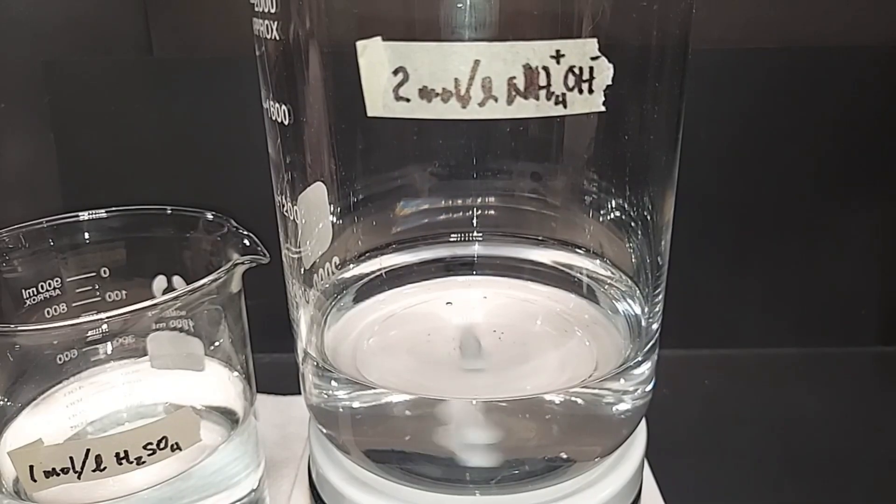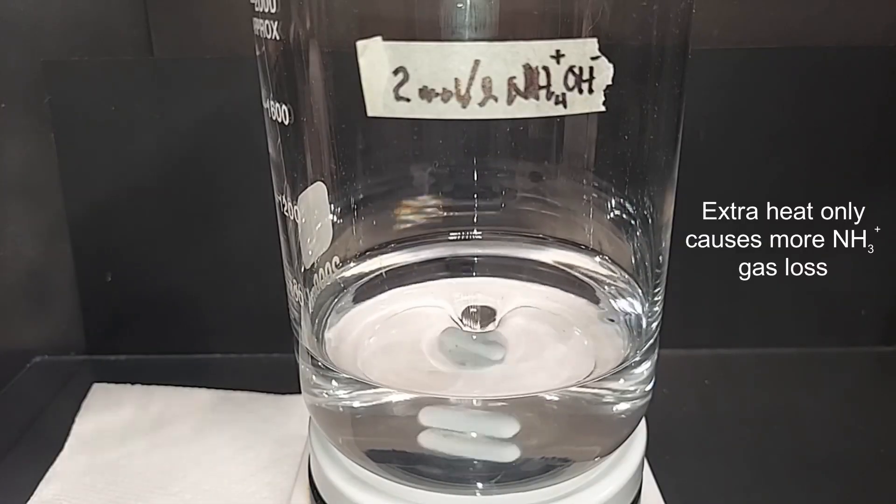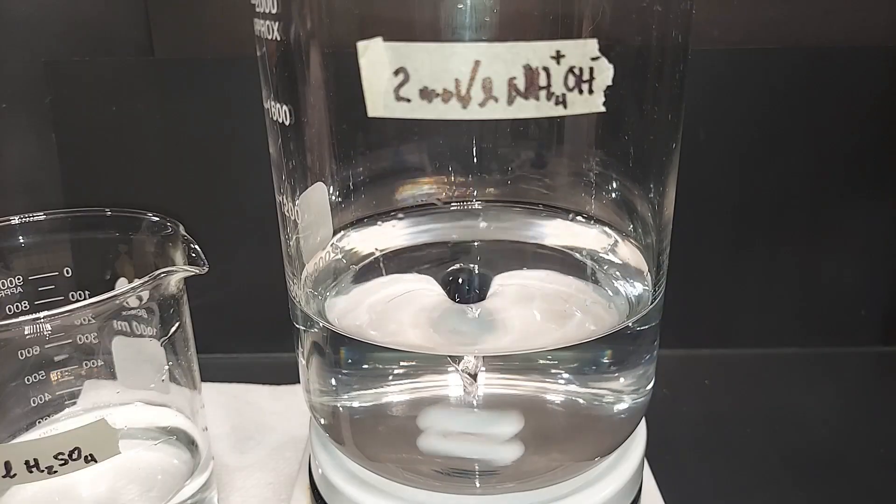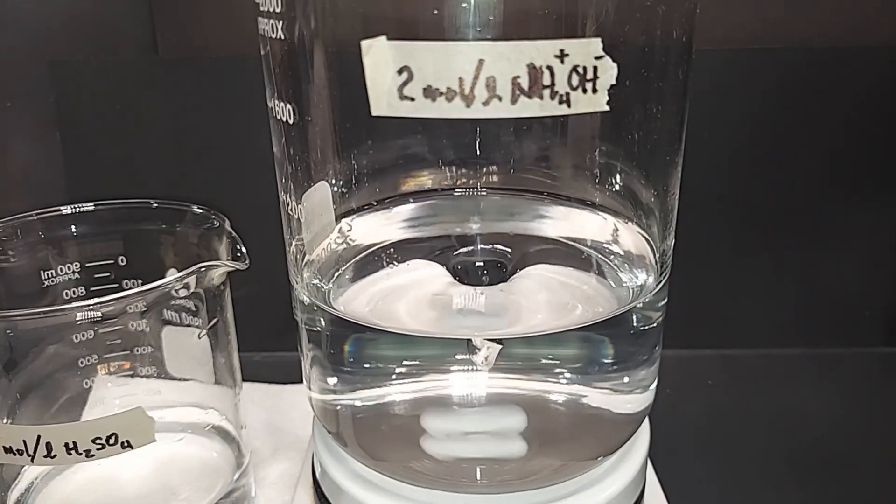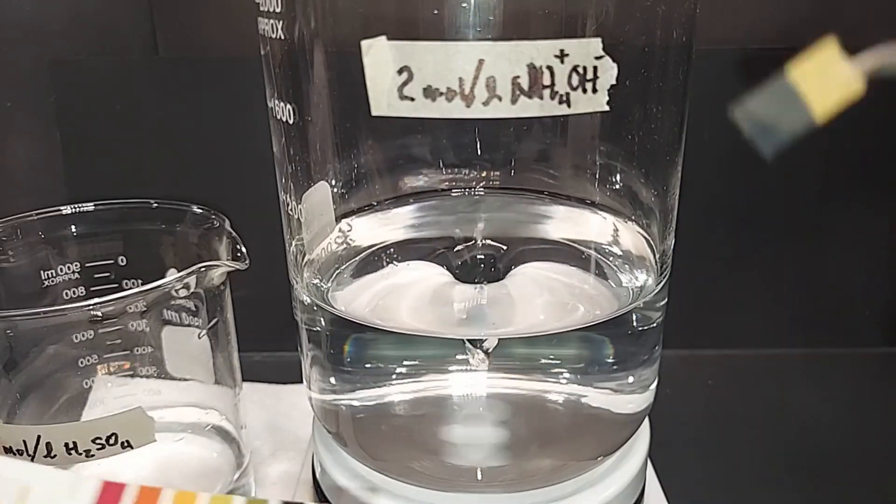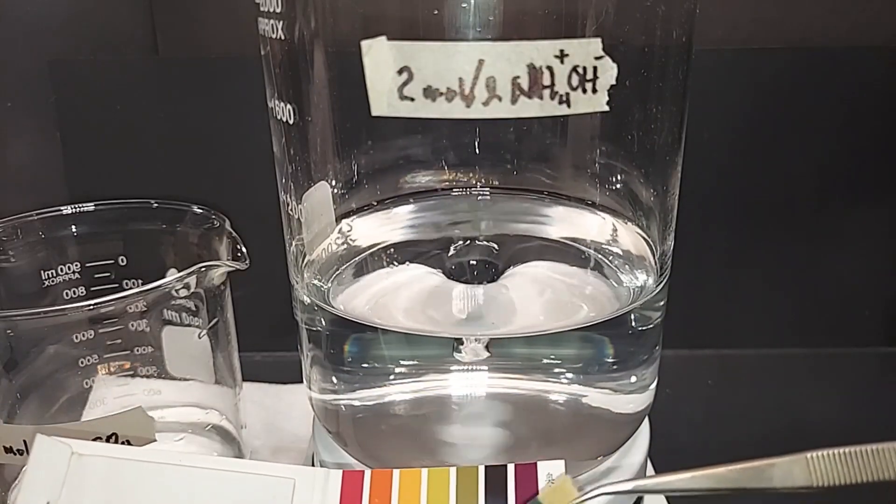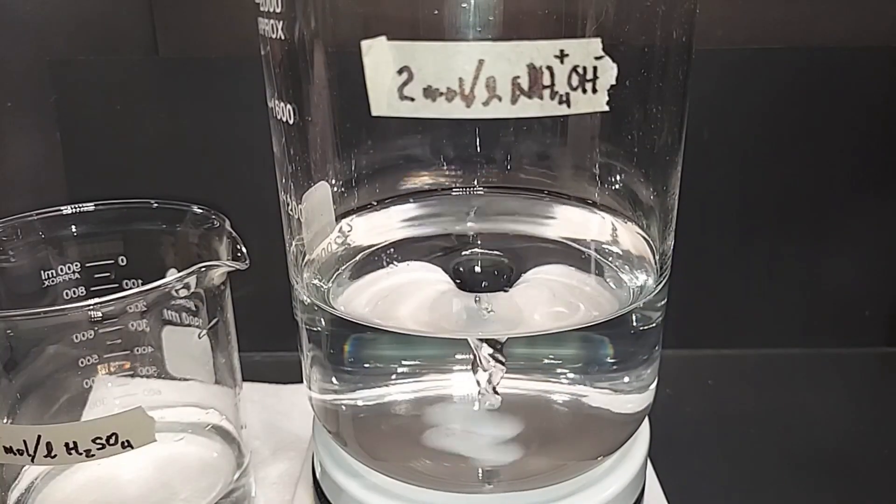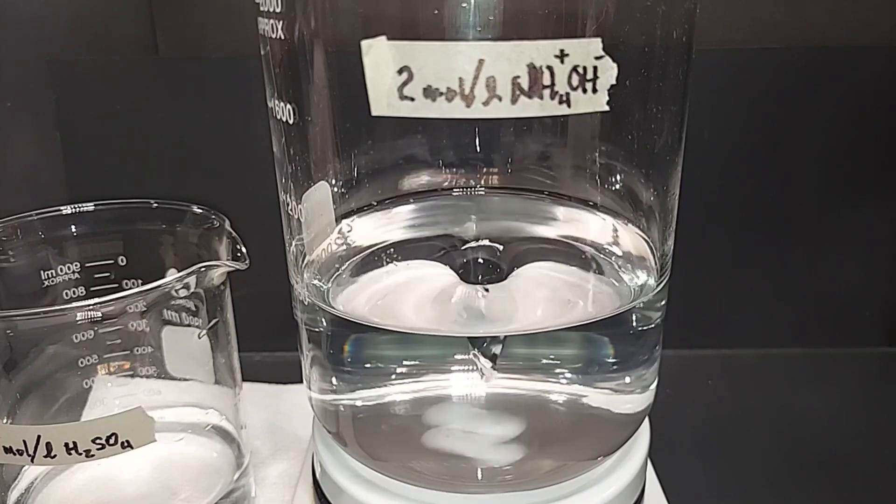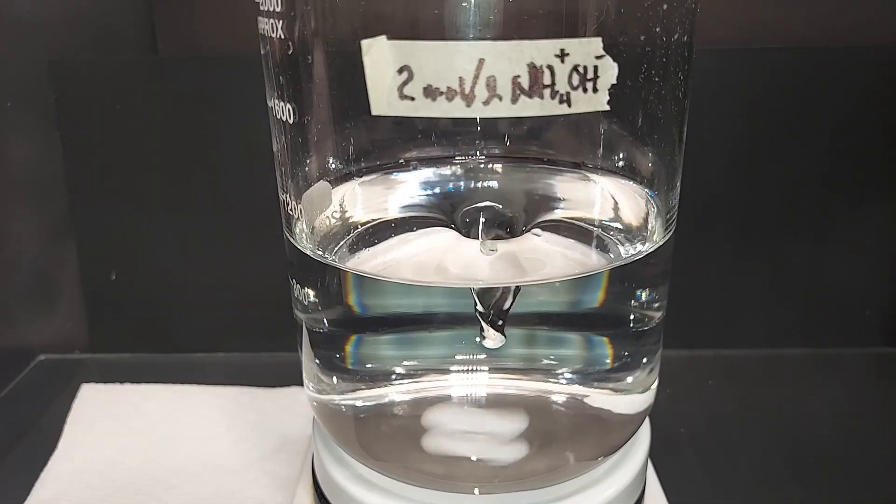Turning on the magnetic stirrer and again because this is exothermic I'll be doing this very slowly. I've added about half of the sulfuric acid solution. I'm going to check the pH now. I really expect it to be pretty basic still and sure that's what it looks like right here, maybe it's lightened up a little bit to maybe a 13 from a 14. Once we add all of that sulfuric acid solution we will overshoot the pH a little bit, we want to do that.